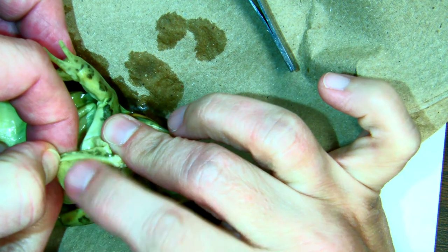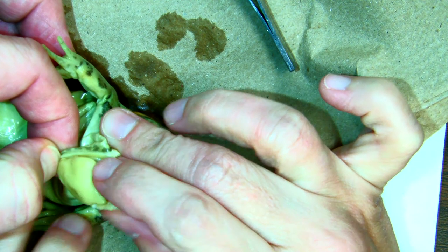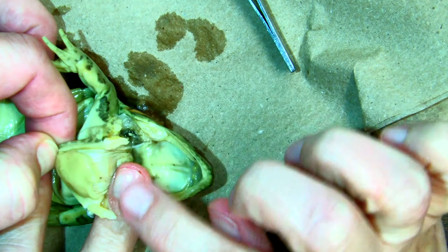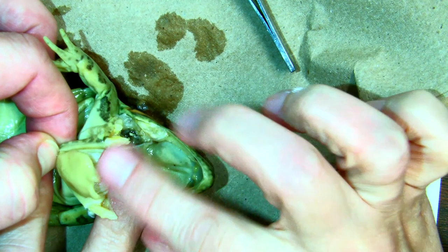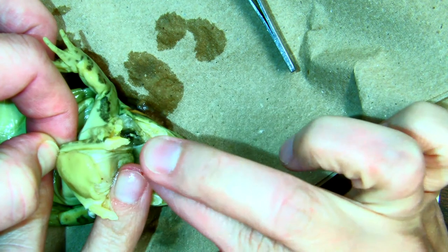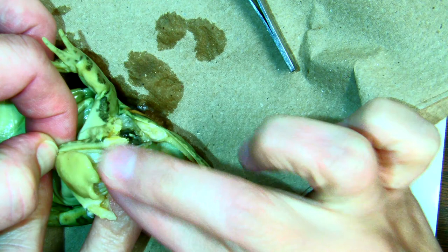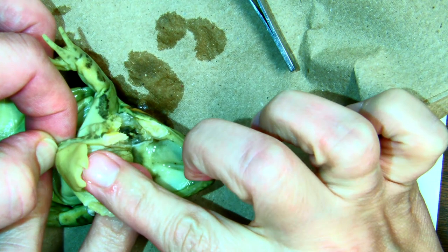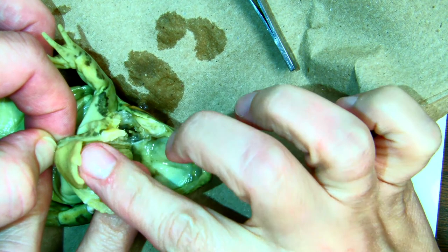So we have his tongue. Right now it's in a resting position, but it can expand long out. And if you see these little finger-like structures at the end, they kind of grab a hold of their prey and then bring it back into their mouth. That's one of the ways they can hold on to their prey. With these finger-like projections.